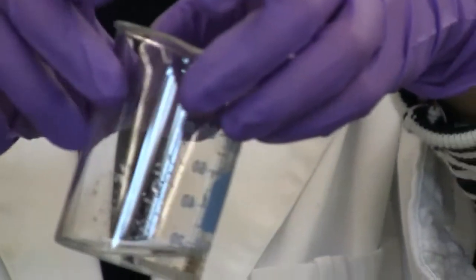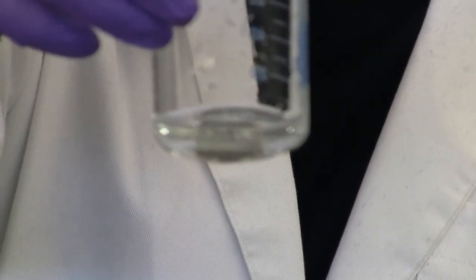Can you see that? Maybe we can zoom in a little bit. If I shake, you can see it more obviously. There are 2 reactions happening here. In the procedure, they describe each reaction: what the reactants are and what the products are. So make sure you write 2 chemical equations here. Now, it seems like the bubbles are going down, right?